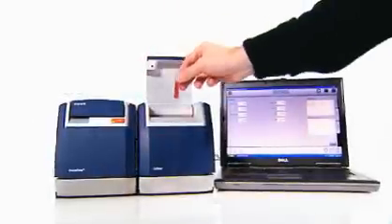First, fill the color sample holder using a pipette and load the sample holder in the module.